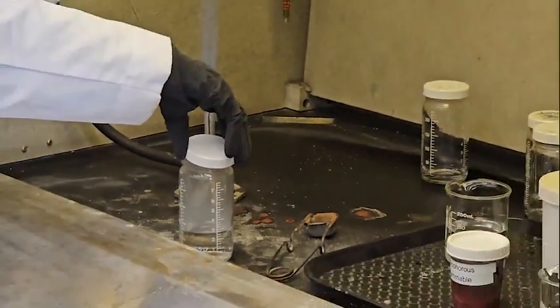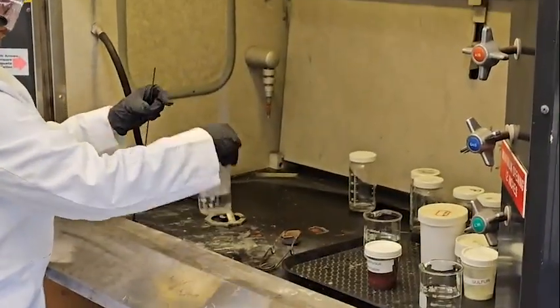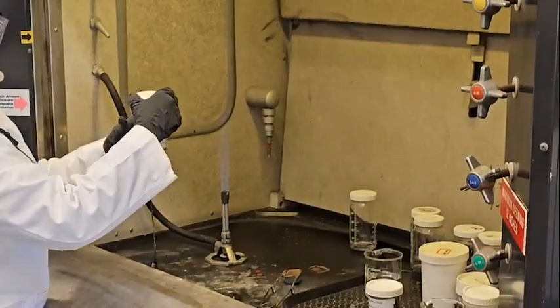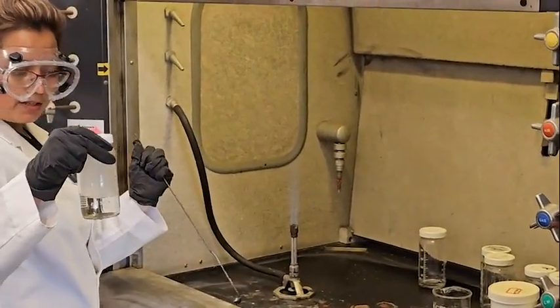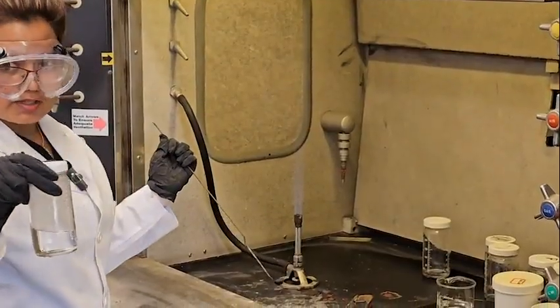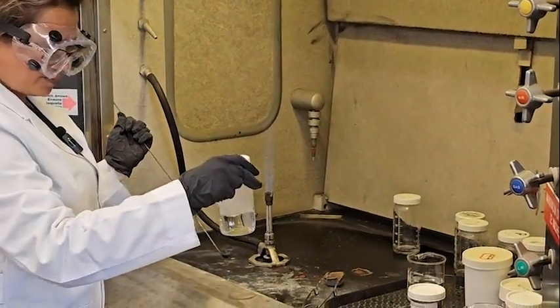Okay, we are going to let it be there. Sulfur with the oxygen makes sulfur dioxide or sulfur trioxide. We don't know; both of them it can produce.